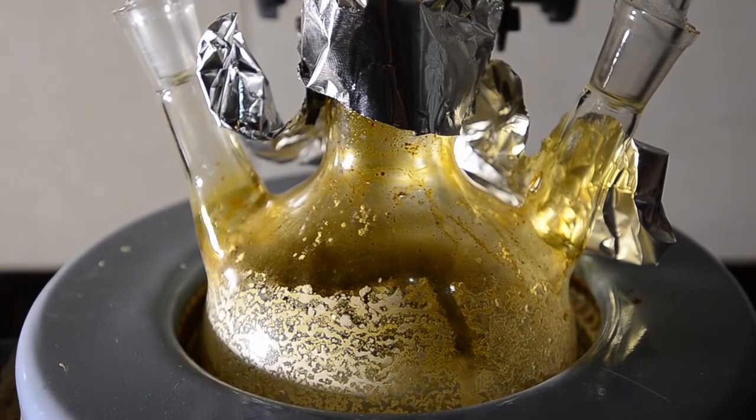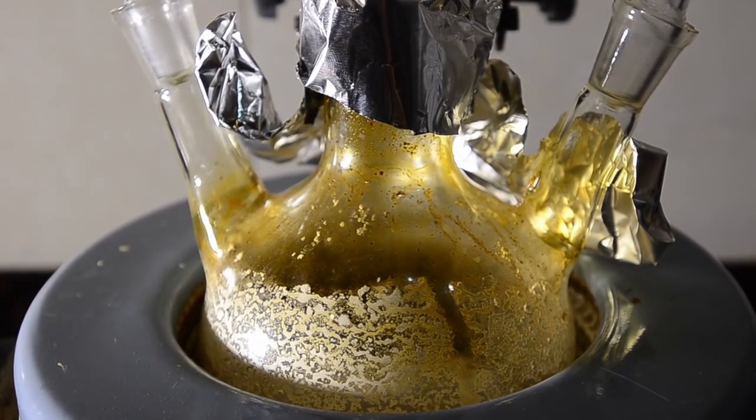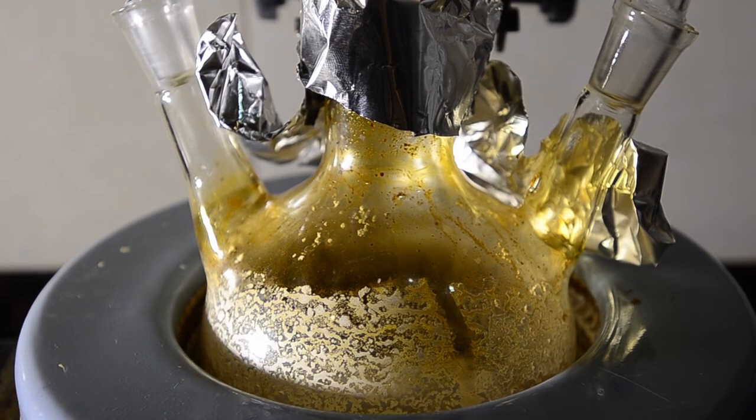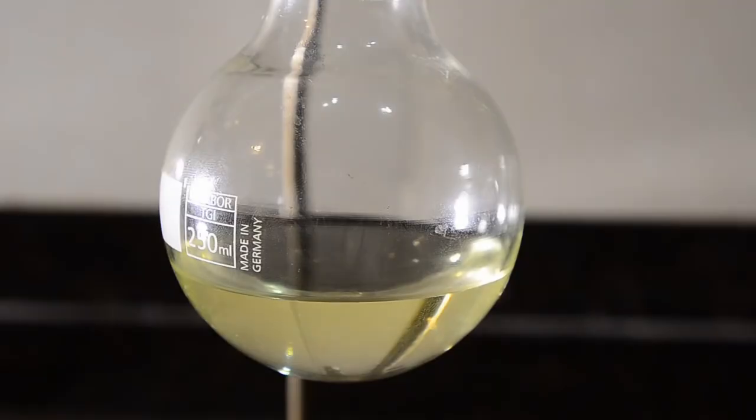It took a good hour and a half before the distillation died down to a very low level and the contents of the flask turned a yellow burnt color.